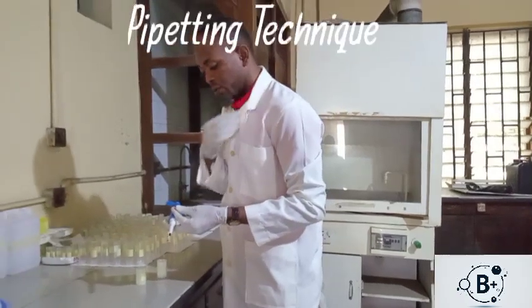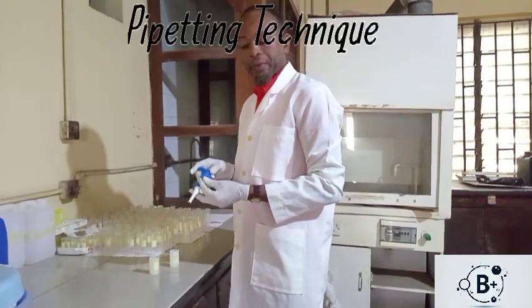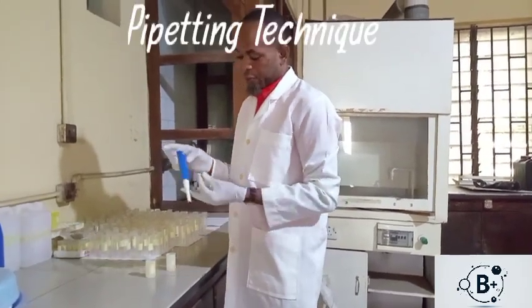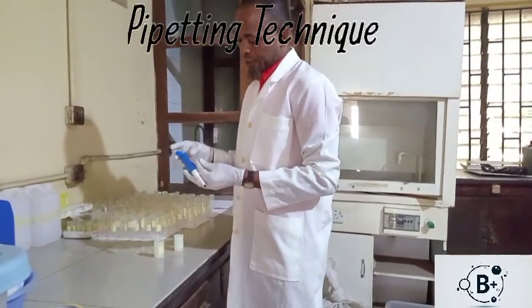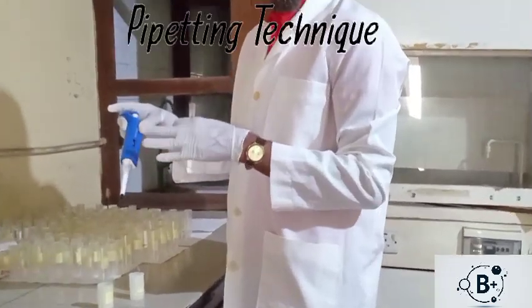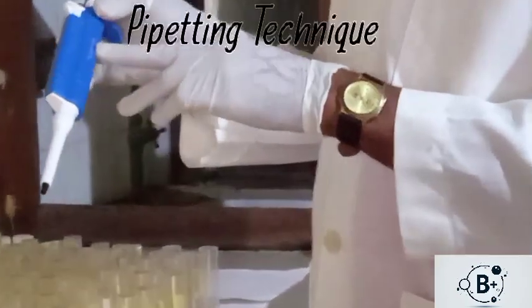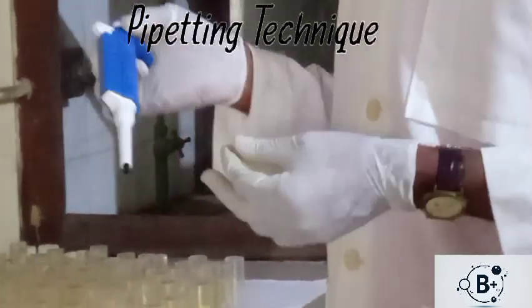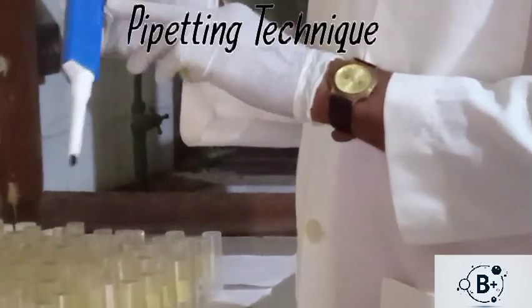Today I want us to look at how we use the micropipette. So this is a micropipette. Now it has different ranges. So we have those of say 0 to 100 and 0 to 50. But this type is 0 to 100 microliter, so you have it written here. And this is 0 to 50 microliter.